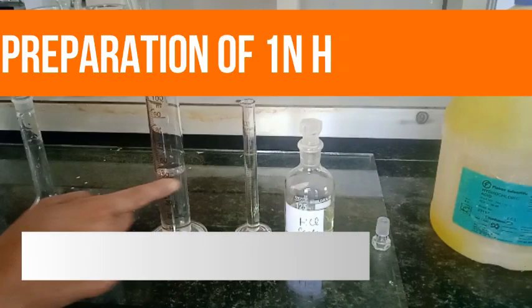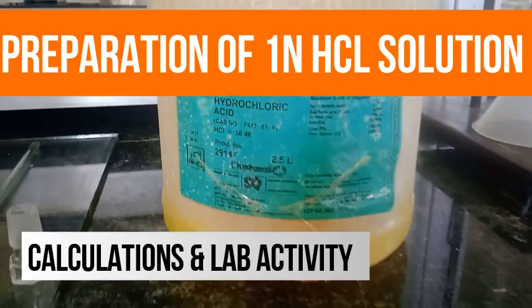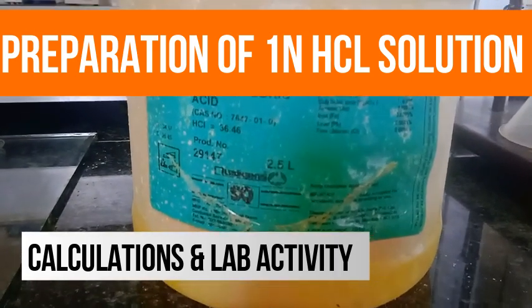Hello everyone, welcome back to Spectrum Classes. In this video we are going to prepare one normal HCl solution from the concentrated HCl solution.